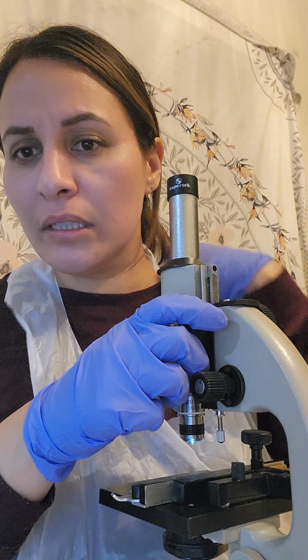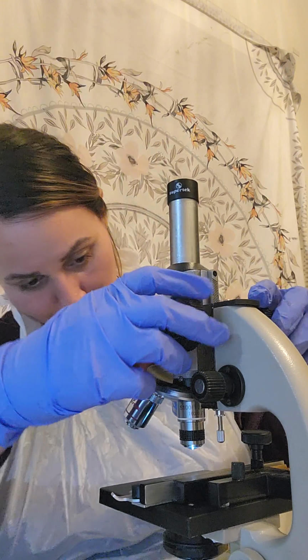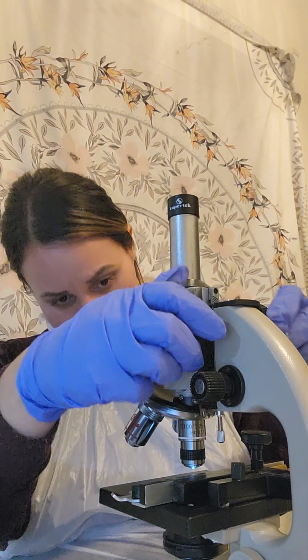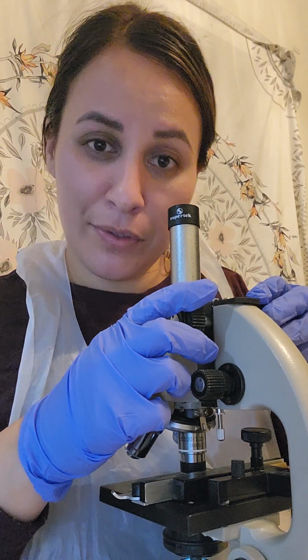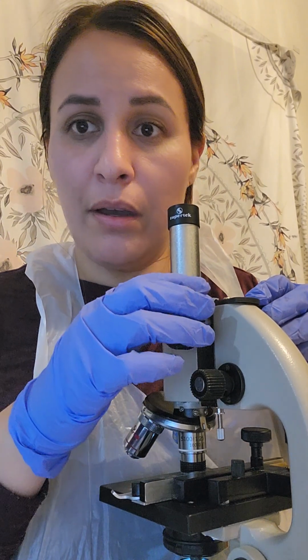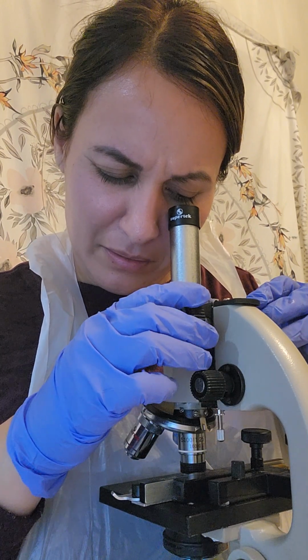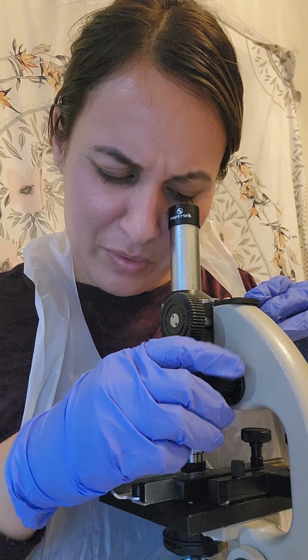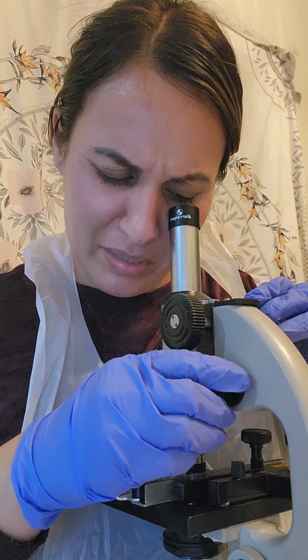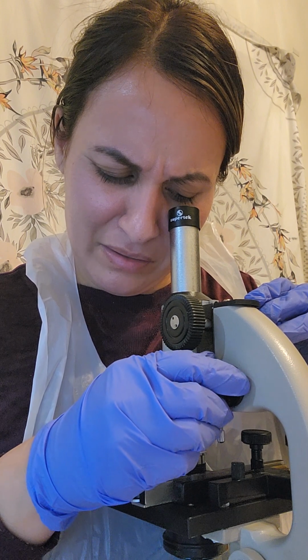Let me see here. With the lens tip touching the oil, focus. Okay, so basically I have to go all the way down on this. Okay, so that's the furthest I can go. So then for this one, it's just a little bit of fine adjustment that I'm going to be doing to see if I can get anything into focus here.